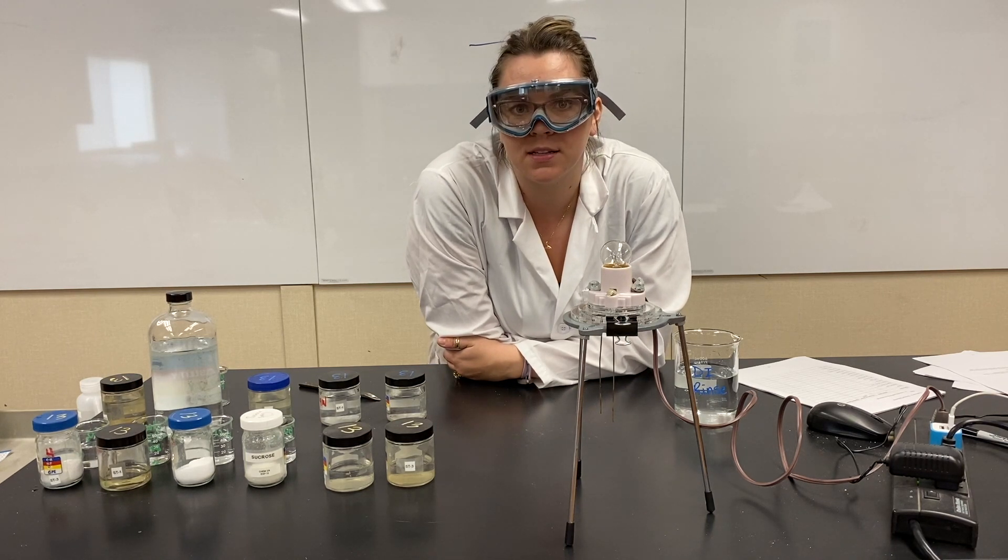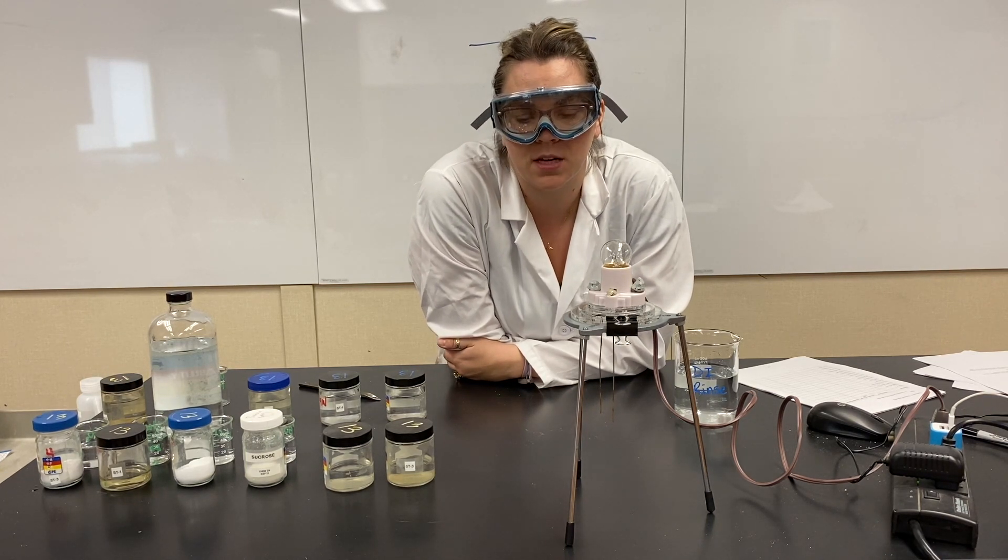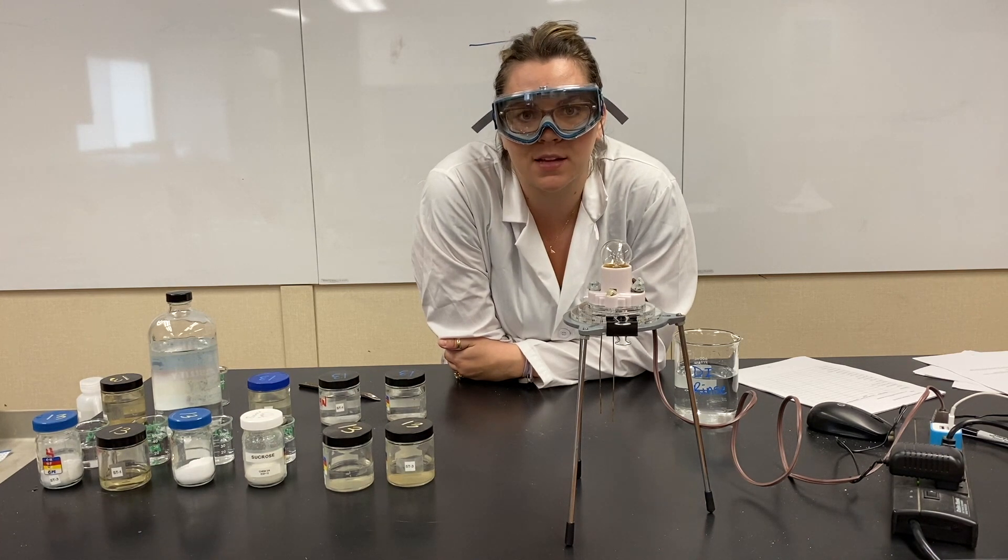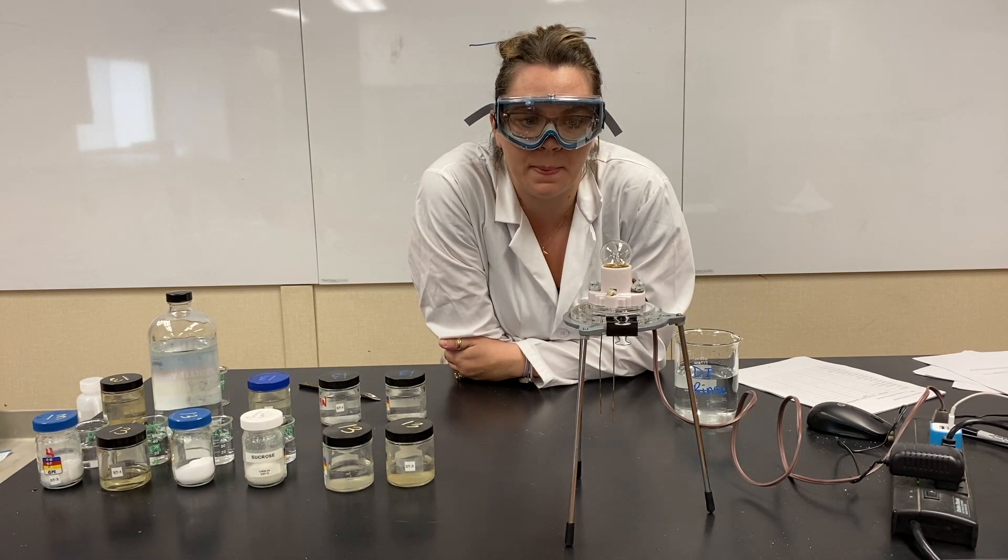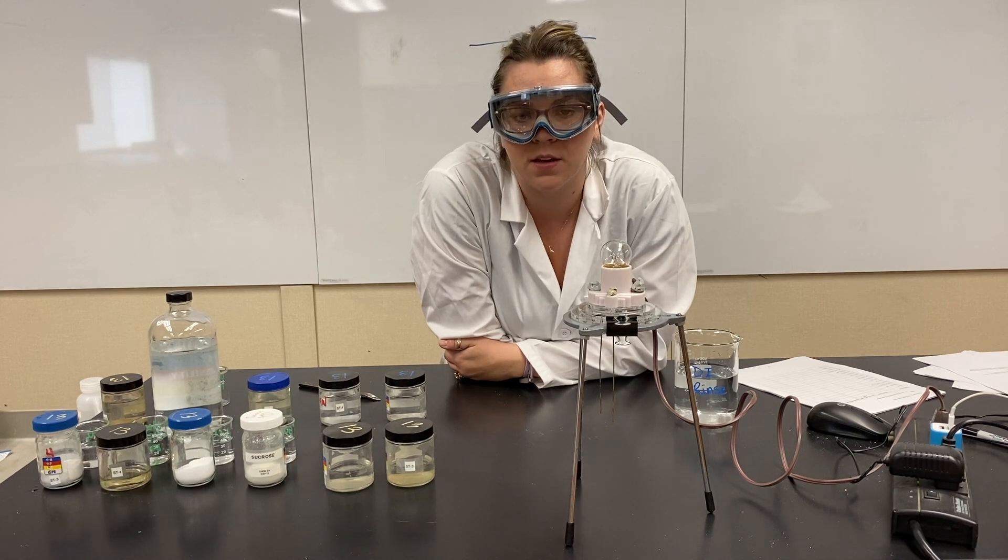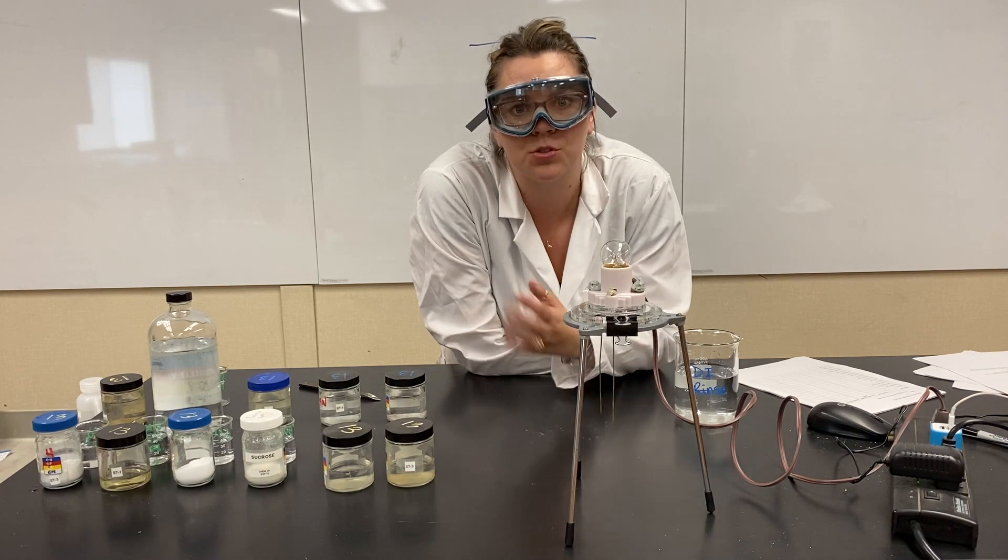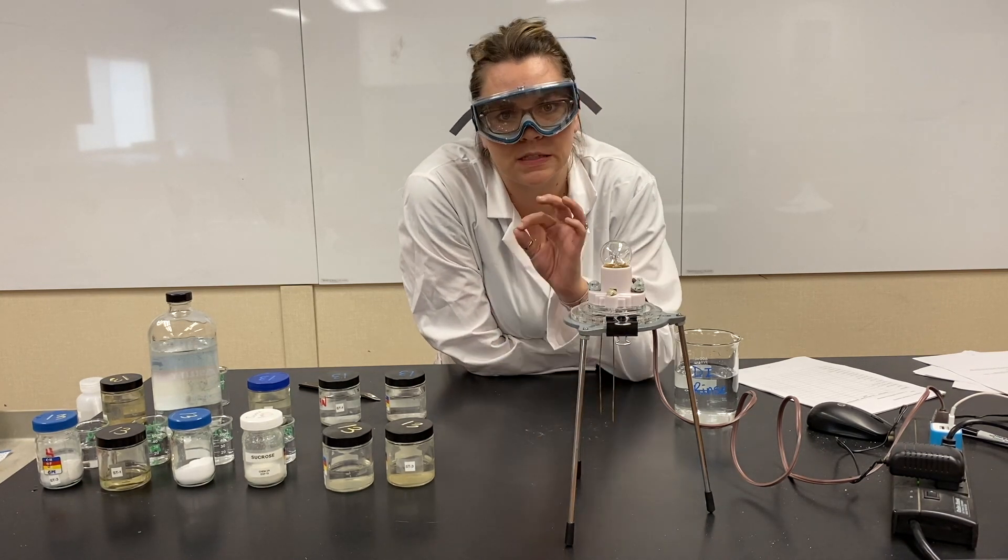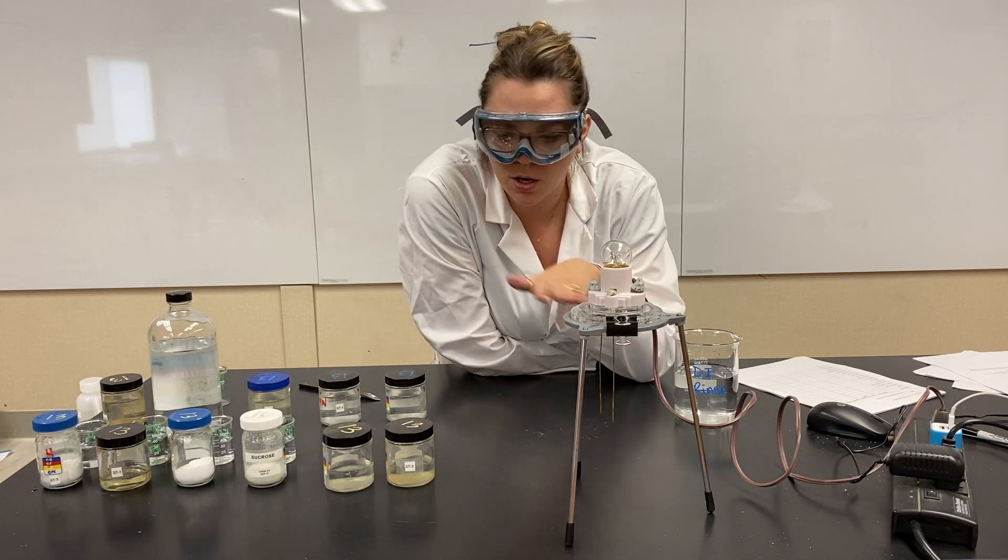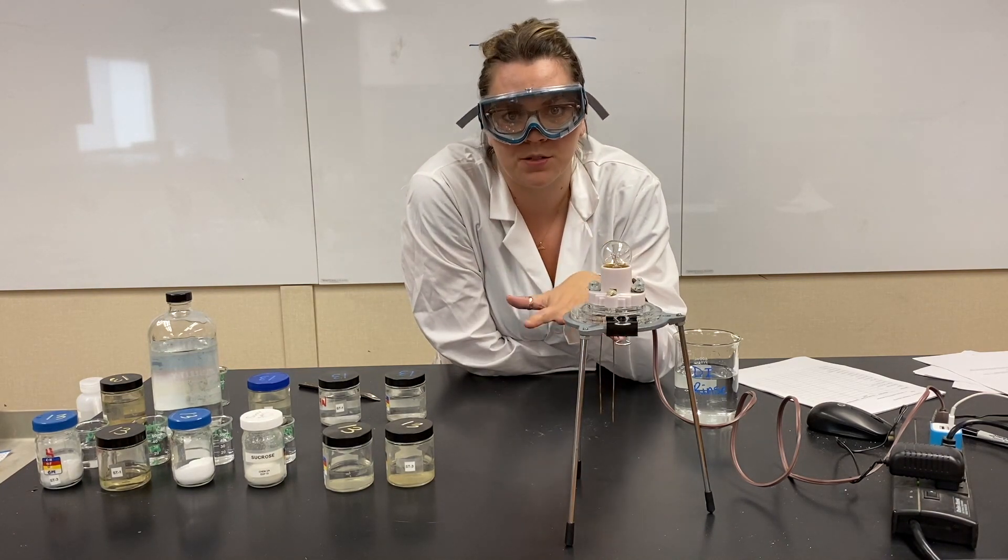So we are going to be looking at different electrolytes. An electrolyte is just a solution that has ions in it, basically. The more ions there are, if a solution has a lot of ions, it's going to be a strong electrolyte. If it has just a little bit of ions, it's going to be a weak electrolyte. And no ions would be a non-electrolyte.